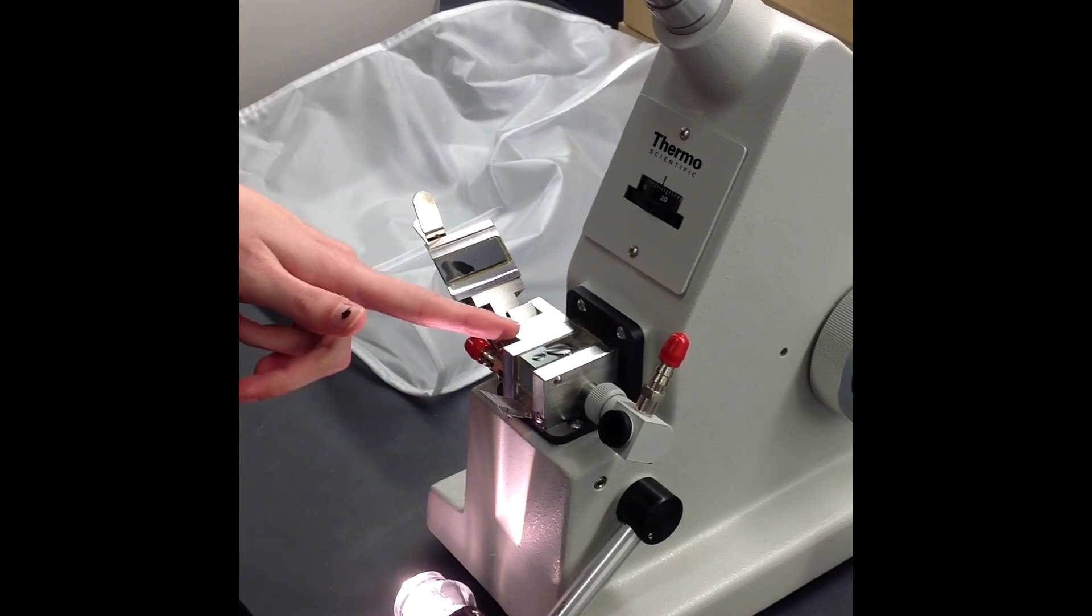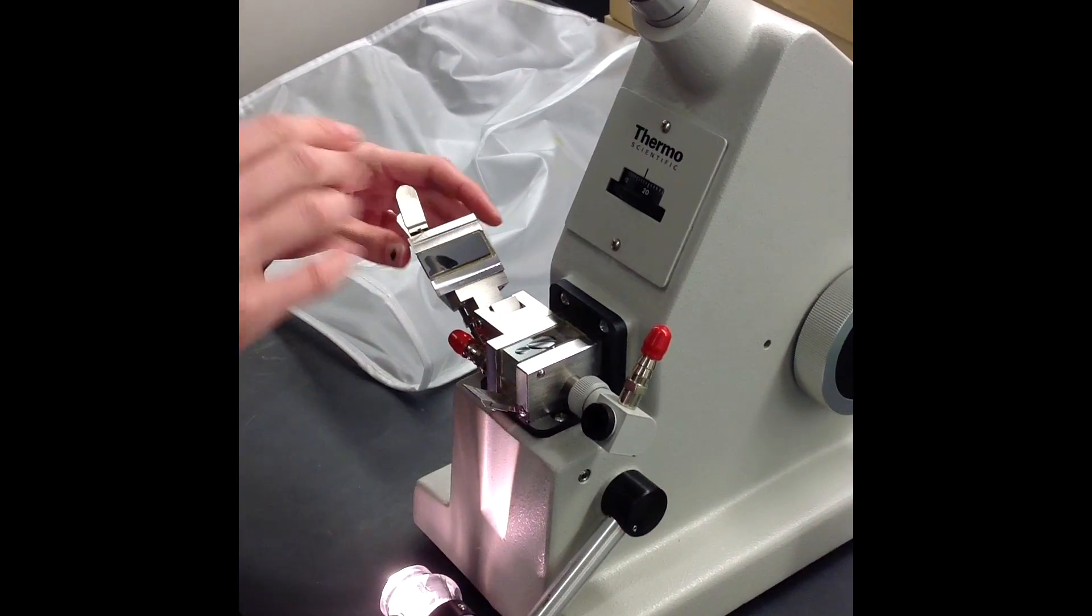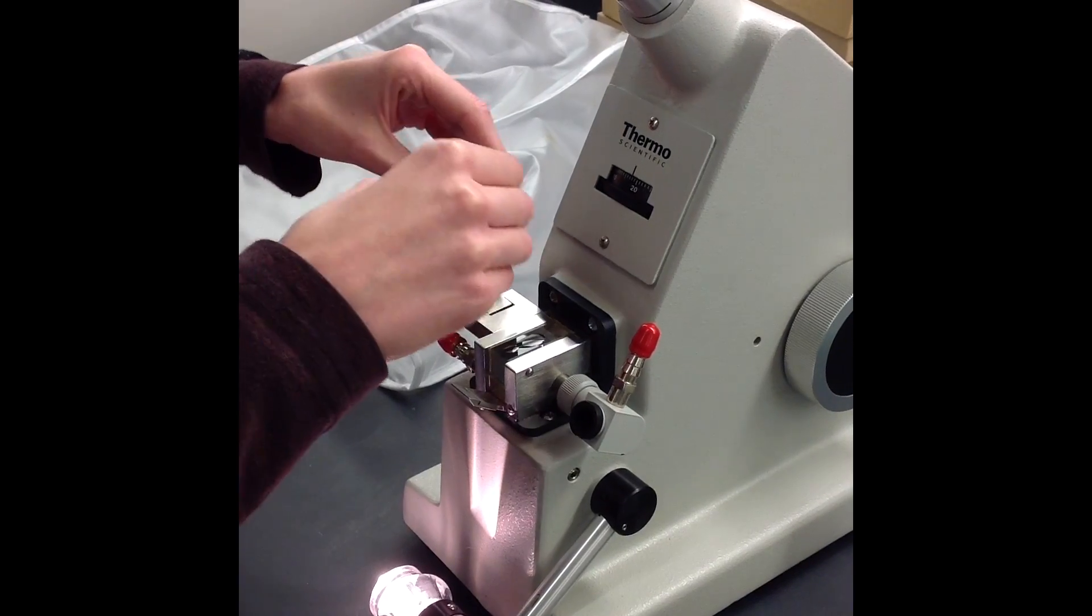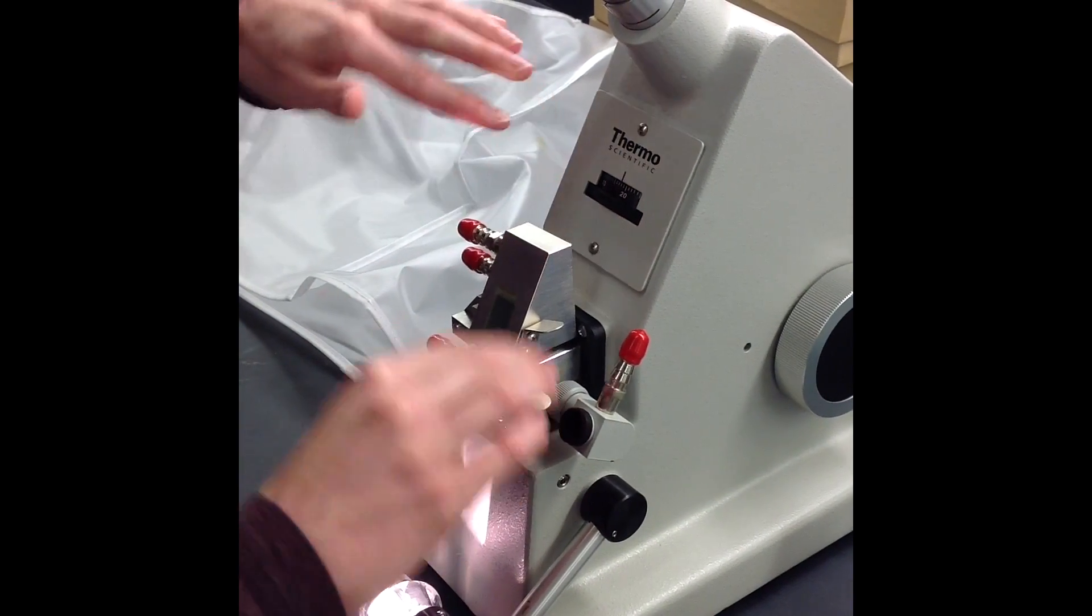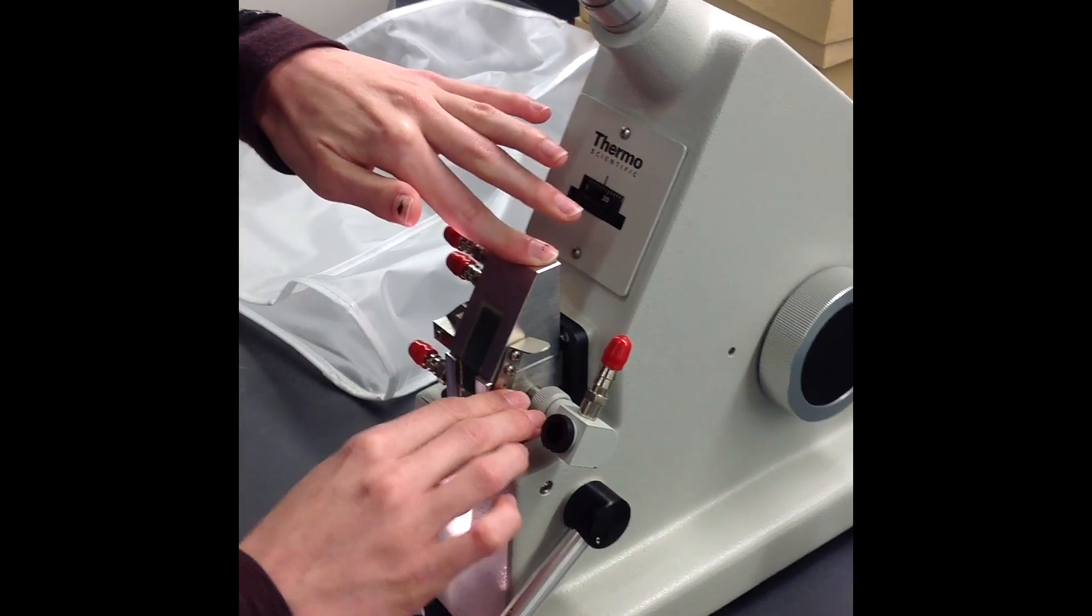Do not scratch this. Do not rub anything up against it - it's very expensive. Then I close it and it has to snap shut.